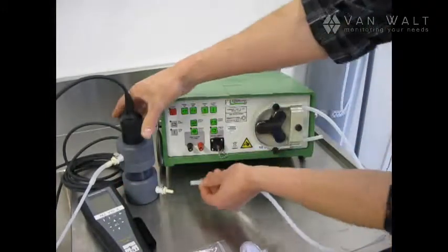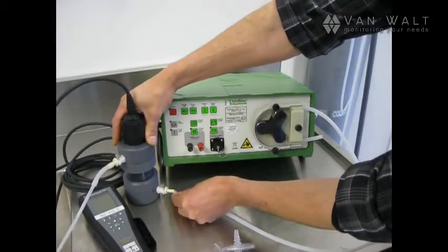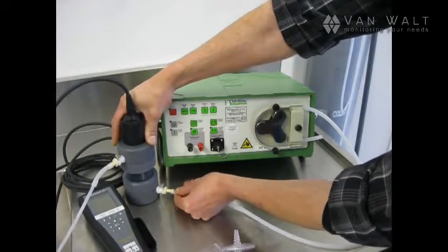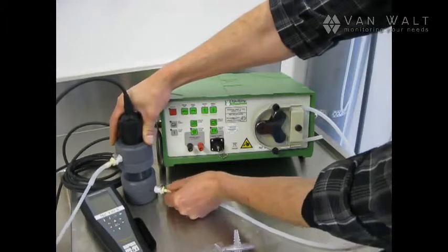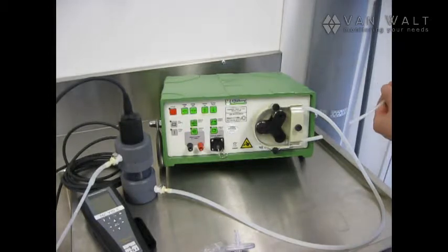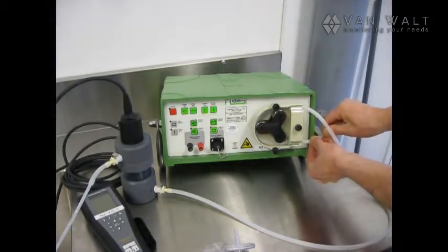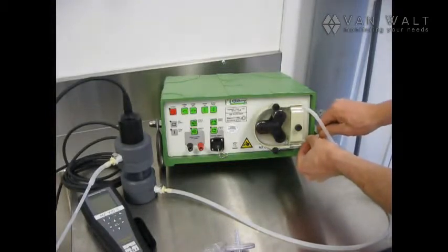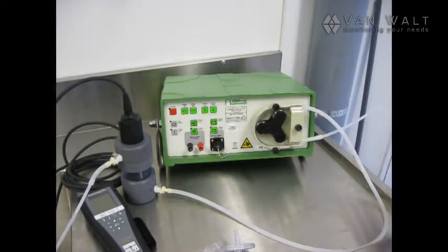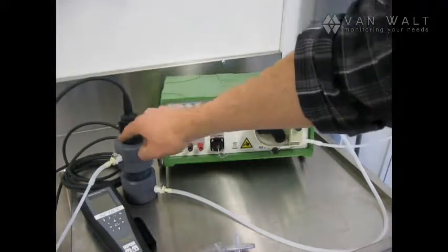Okay, now this portion of the tube can go into the bottom of the flow cell. There we go. And now all I need to do is connect up my sample tube. And there we are. The pump's connected. We're drawing from the sample tube through the pump into the flow cell and out again.